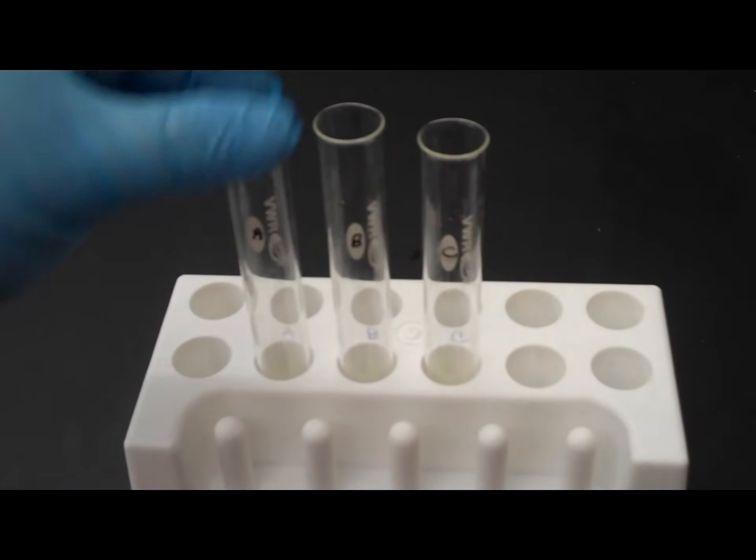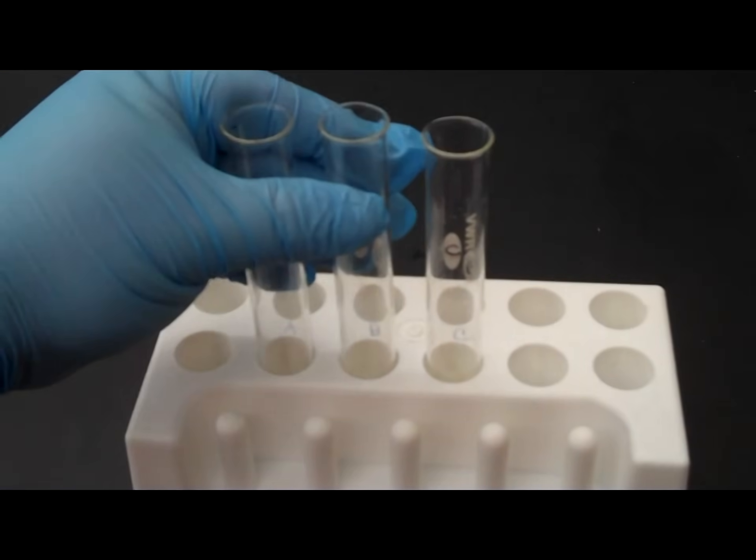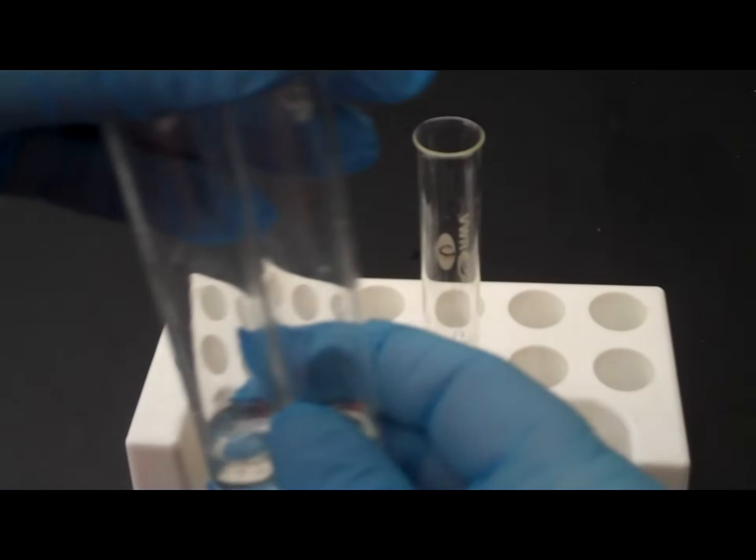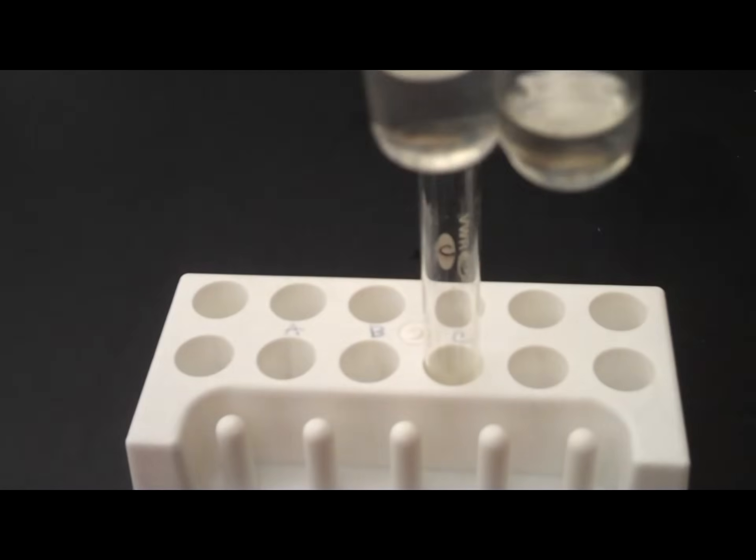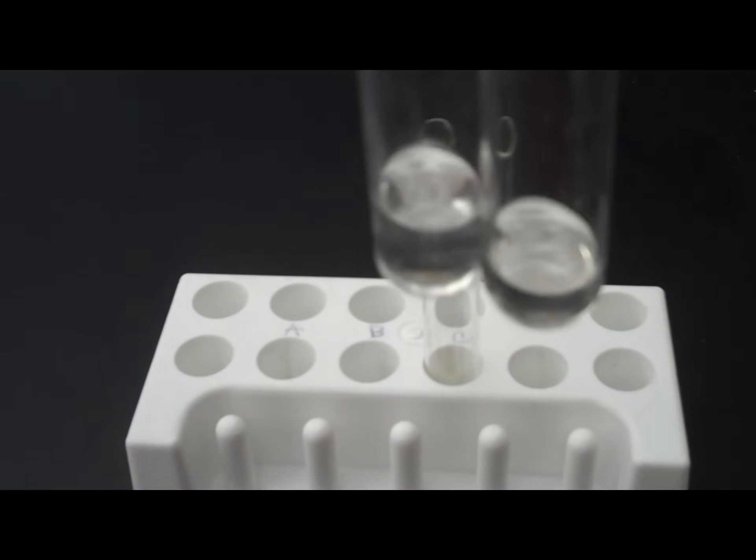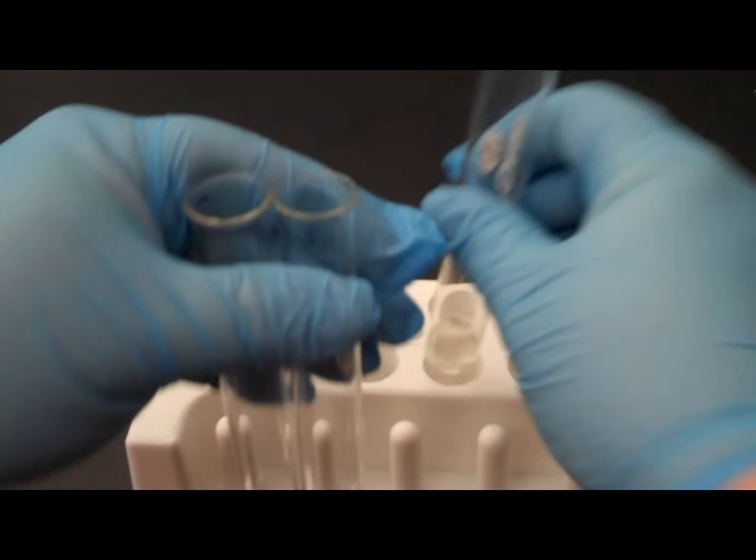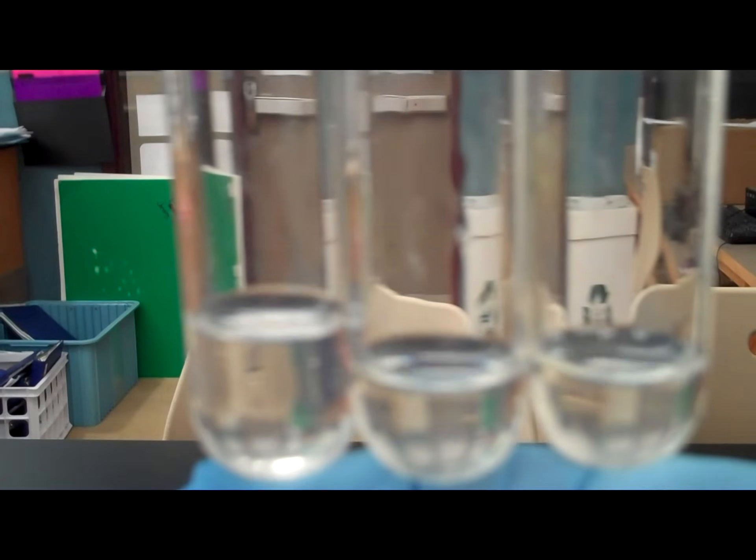Okay. Since we only put the vinegar in test tube A, we have a difference in volume in the test tubes. So, I want to even that out. I want to even that volume out by using distilled water. So, I'm going to grab my test tubes. See the volume difference?